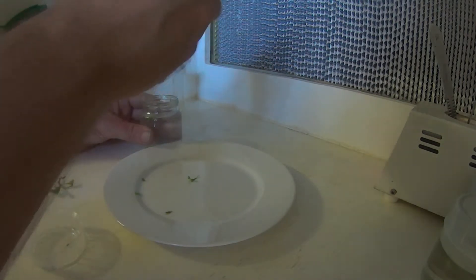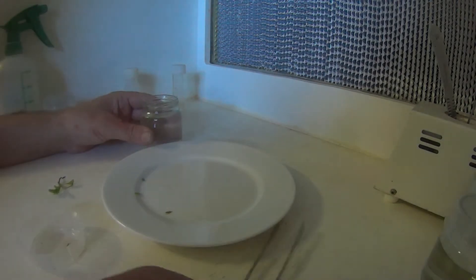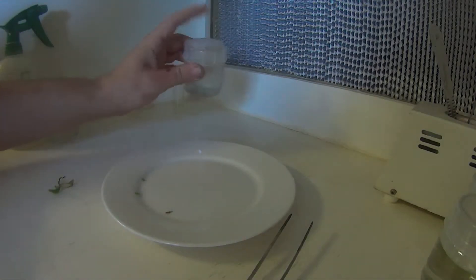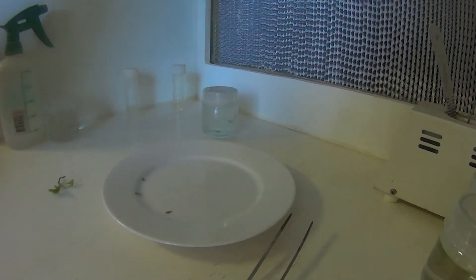It just depends how contaminated your plants are. But any longer than that, it'll probably start to burn them and kill the actual plant itself. So we've also got a drop in there of Polysorbate 20 just as a wetting agent to allow the bleach to get into all the little crevices. We'll give them six minutes in there.